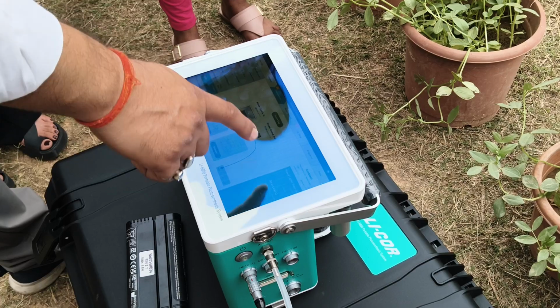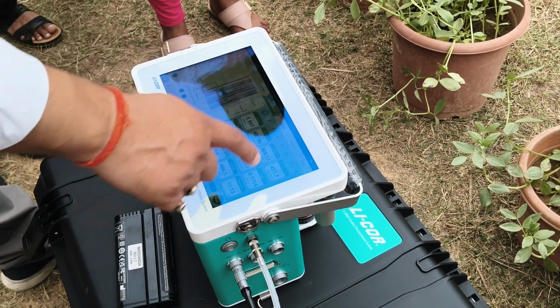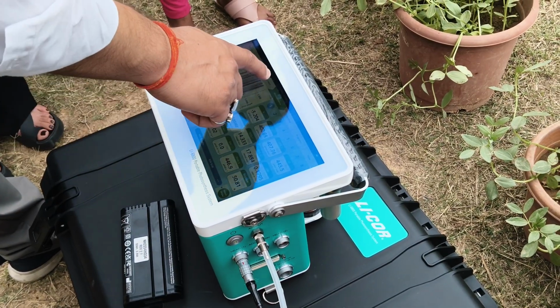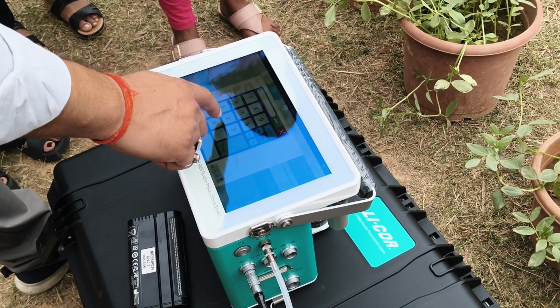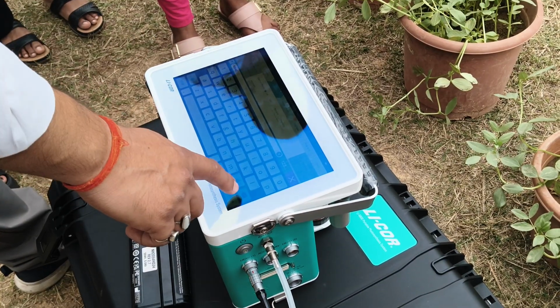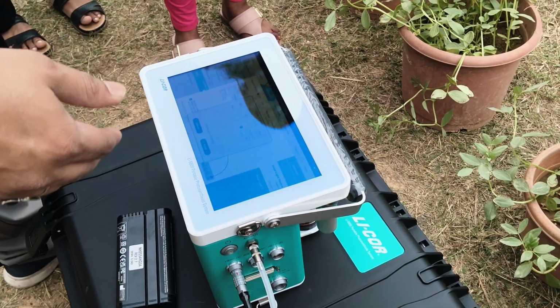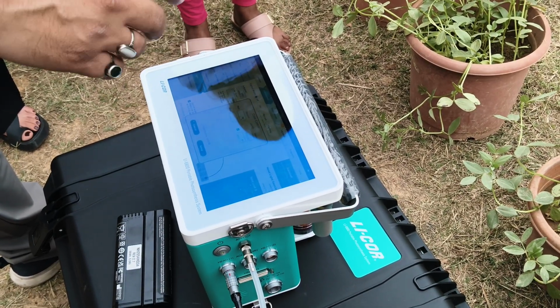Okay, and there's a light also, you can control from 0 to 3000 micromole. Right now in ambient there is just 100, but it cannot do any measurement at 100. So we can increase it to around 1000. We can fix this around 1000. Okay, and there is an option that you can also make a blue and red combination. Some plants can do photosynthetic activity in red also, so you can make some changes. Red and blue combination, 90% blue or 90% red, like this. The light is off.